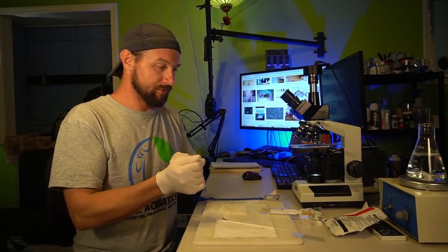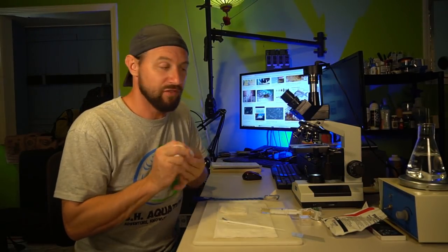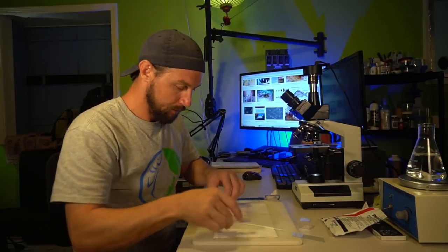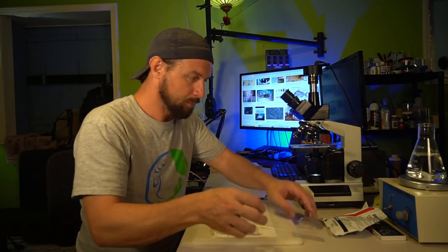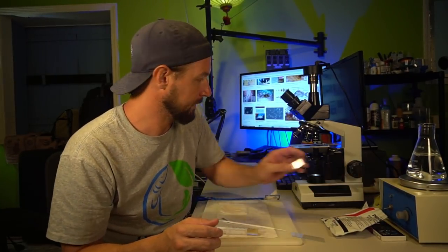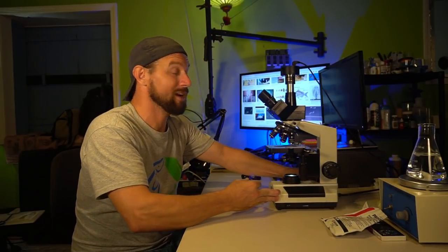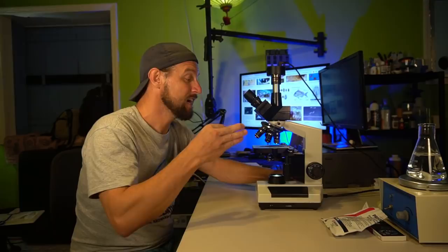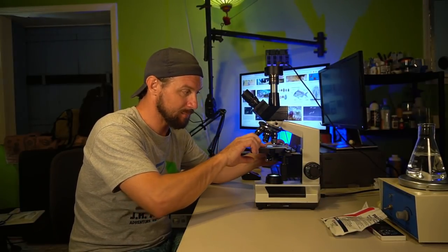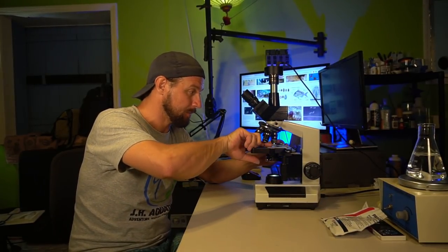All right, that was a little bit scary. The fish is fine, back in the tank. Made a little bit of a mess. This is all pretty much a biohazard right now, to be completely honest. I don't want to waste too much time. I want to get this slide onto the microscope so we can check this out before the slide dries up. We could probably see this parasite alive. I've definitely got a specimen of it. I can see it and it looks pretty nasty.